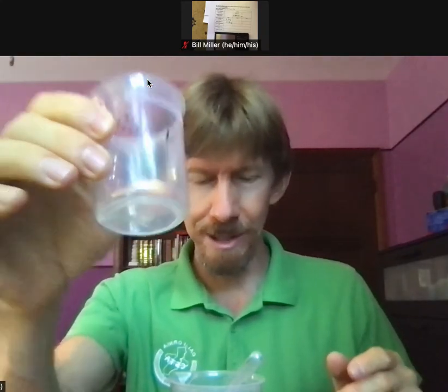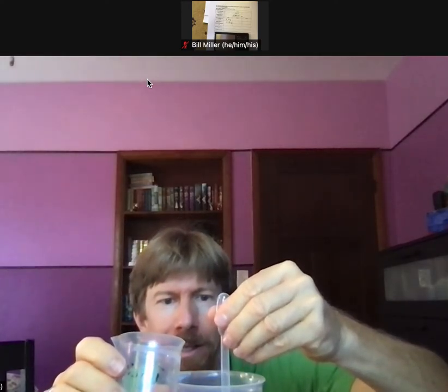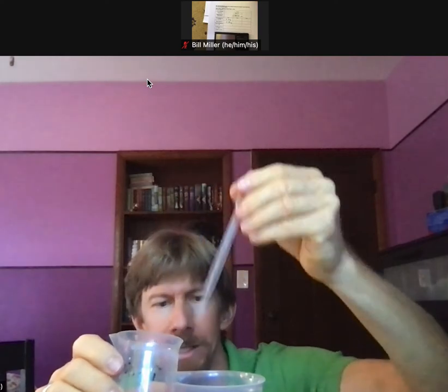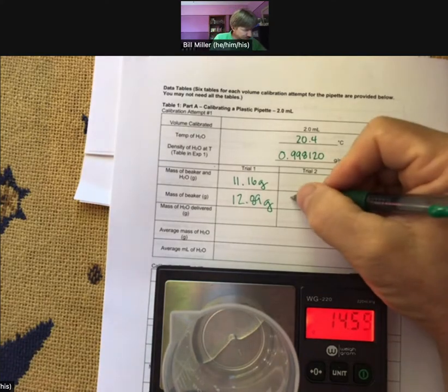I'm not emptying it — I've still got my two milliliters in there. I'll fill right to the line, squeeze until all of it comes out, then go back. 14.59.